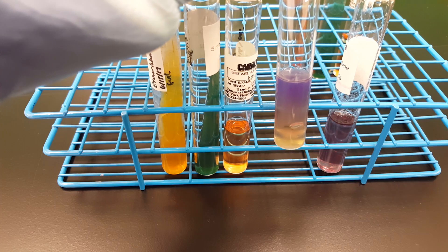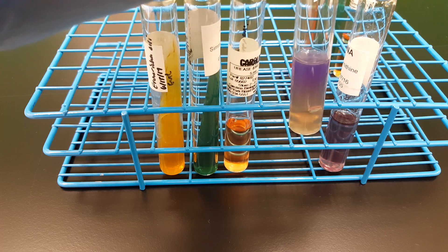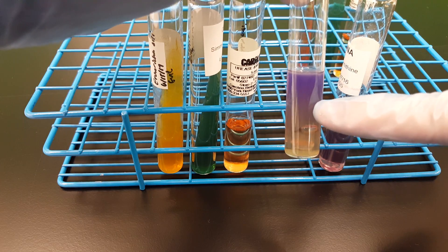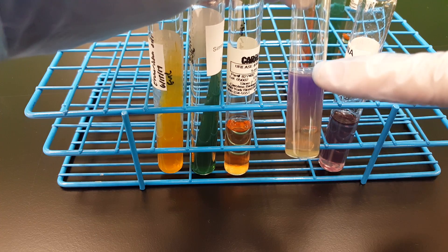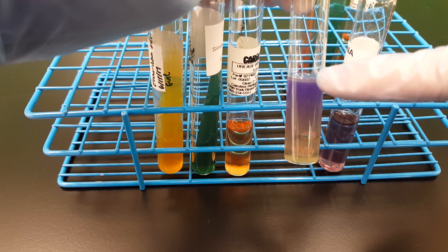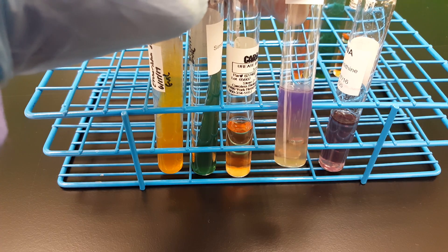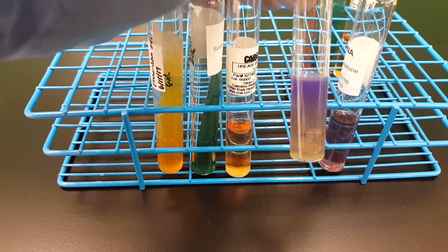I is for indole, and I will be demonstrating indole production in a second. You have to add four drops of the Kovacs reagent to the top of this tube and flick it a little bit so that the indole produced during growth in the media is liberated up into the reagent that rests on top. What we would be looking for is a red or pink color change in the Kovacs reagent to indicate a positive result.